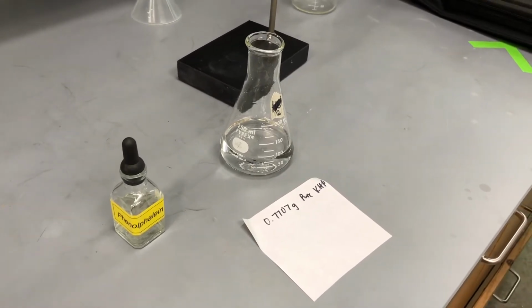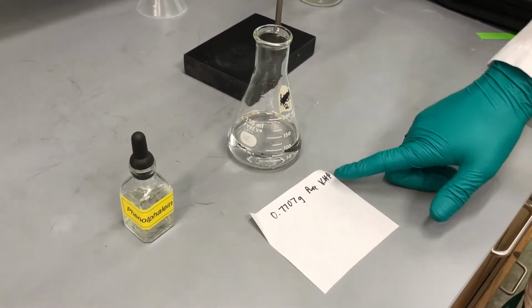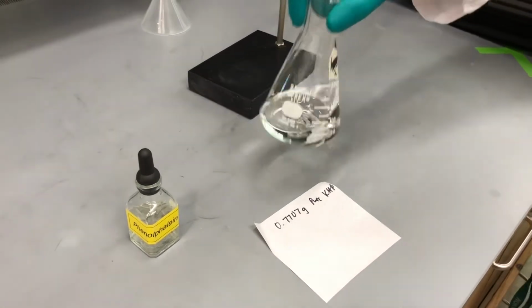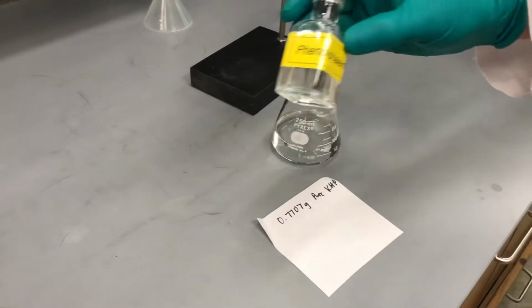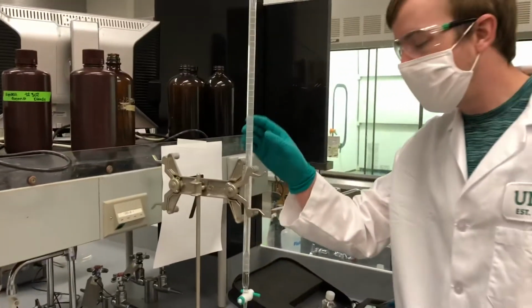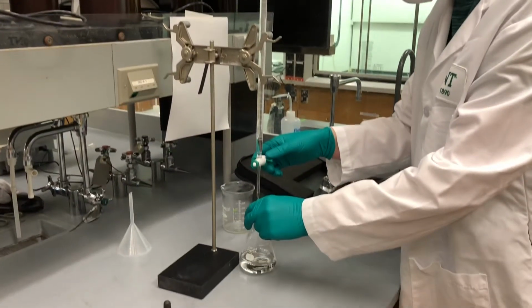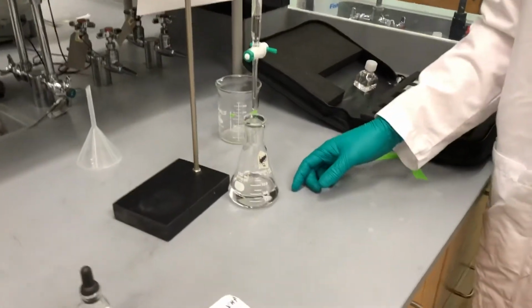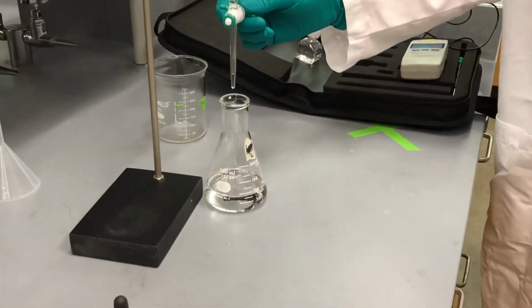We'll show you one example titration. We've prepared pure KHP by measuring out 0.7707 grams and dissolving it into water in this Erlenmeyer flask, and then also adding 4 drops of our indicator, phenolphthalein. We have our sodium hydroxide already put into the burette. Now we're going to add the sodium hydroxide, and we'll look for the endpoint. The solution should go from clear to around a pinkish color, so let's see what happens.